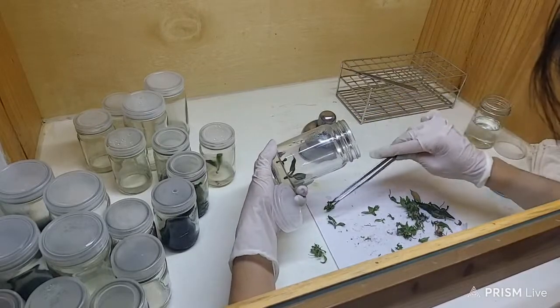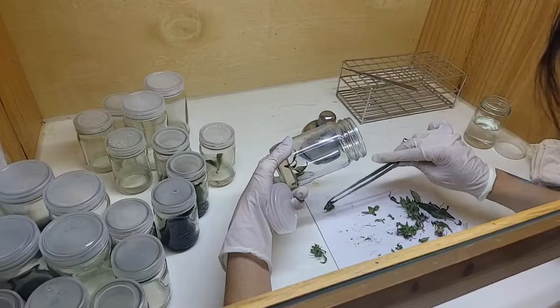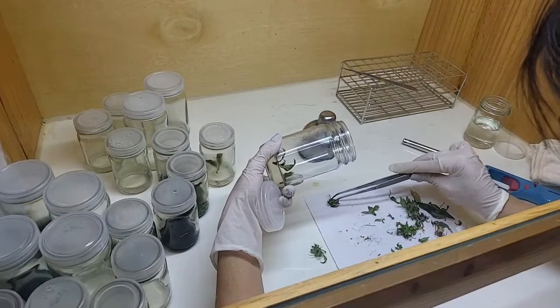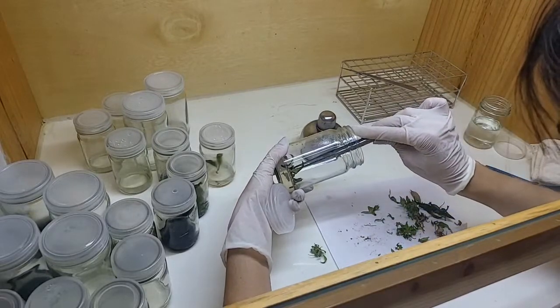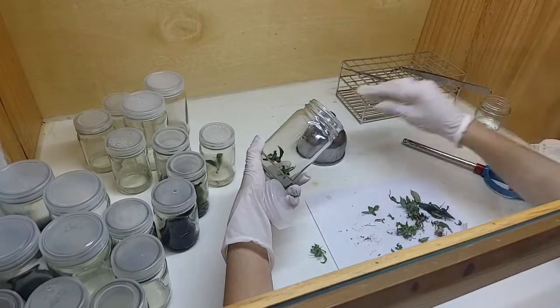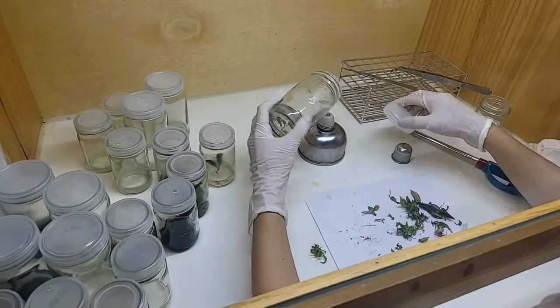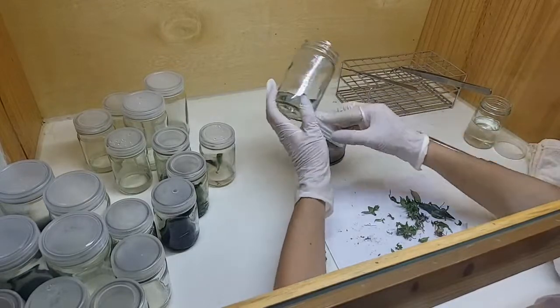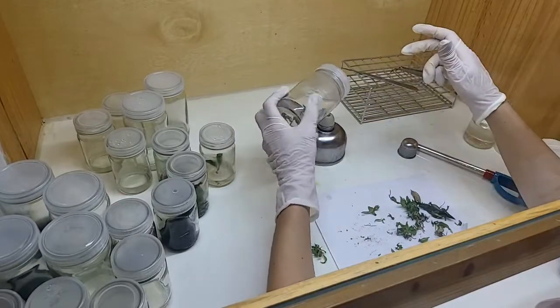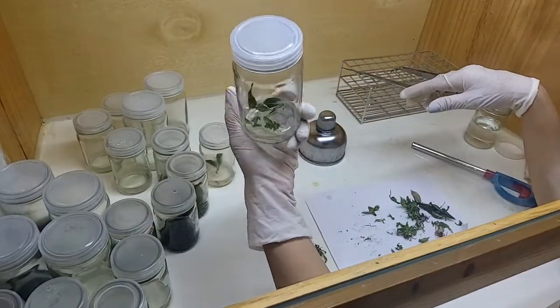You can see the bottle is not standing up straight — that's because we don't want something to get blown in directly; it's a safer method. Also, my fan is blowing downwards, so standing the bottle upright is not a good choice. Then we reheat the jar again and the lid, then reheat once more, and then it's done for one jar.